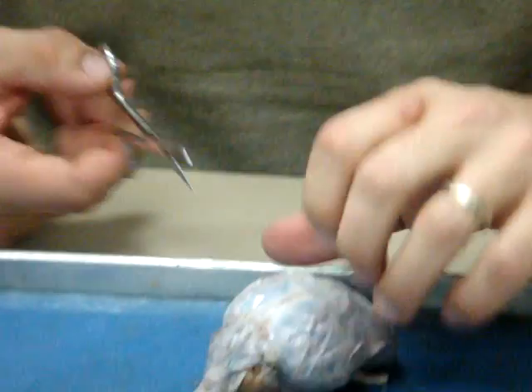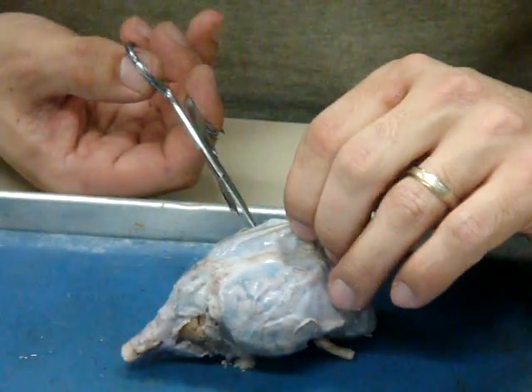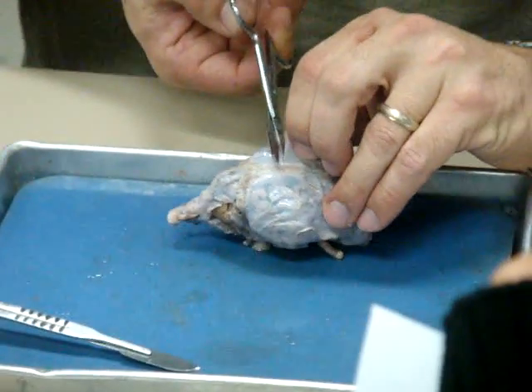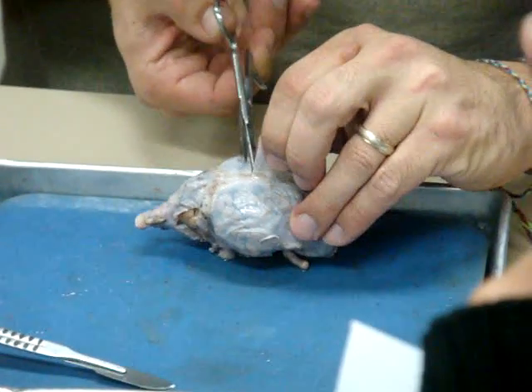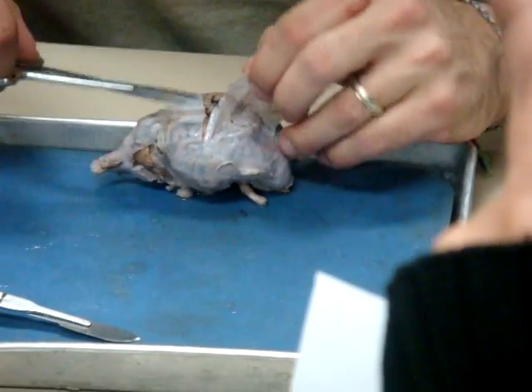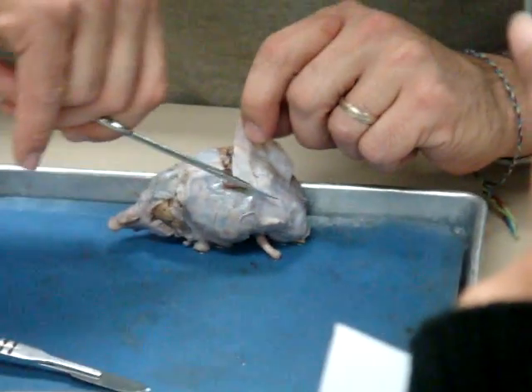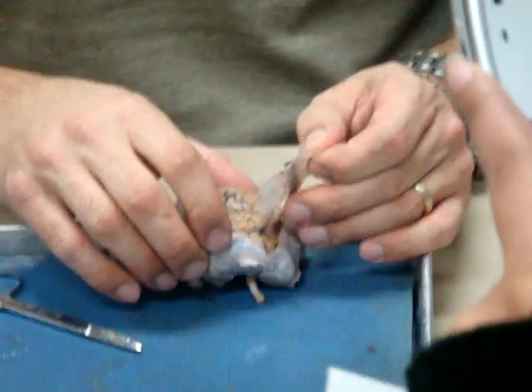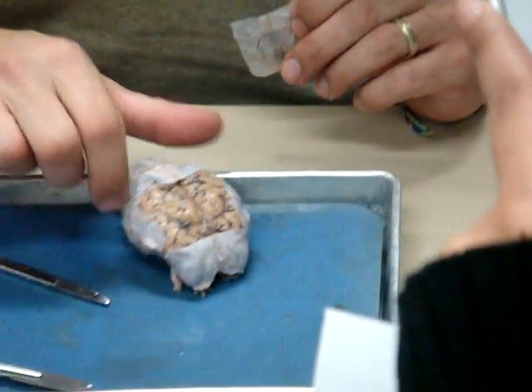I have to cut back a little bit, and then I'll cut across. Again, it gets a little thicker as you get back towards the cerebellum. So again, I want to lift it up, get underneath it, and cut like that, and then I'm going to continue across. I'll cut this little square out. Okay, and then I'm pulling it out from the longitudinal fissure. So now we can see I've removed the dura mater.